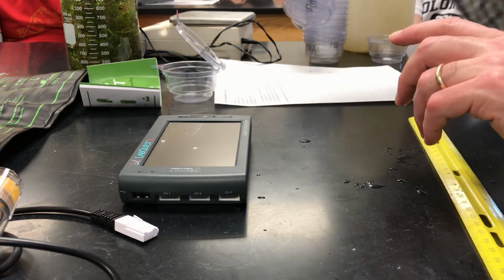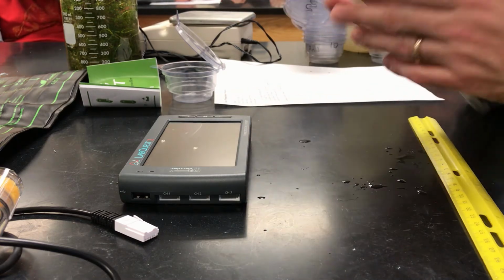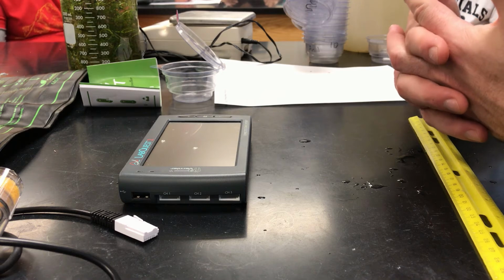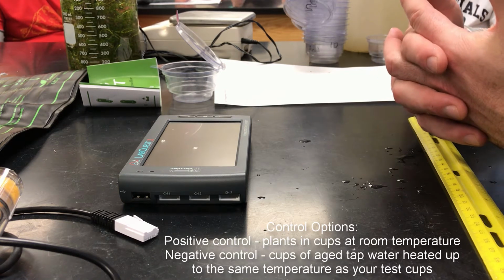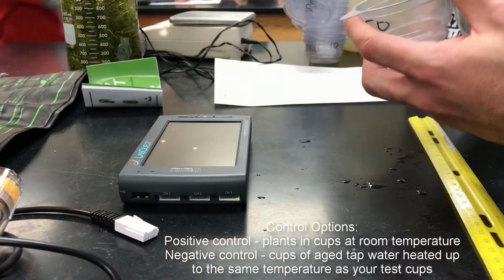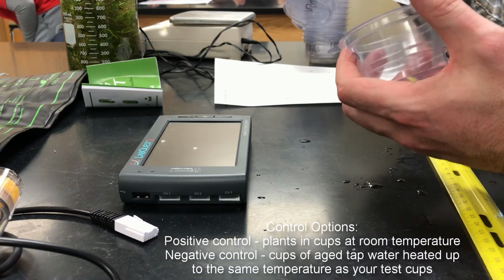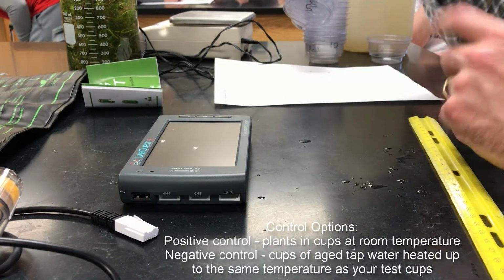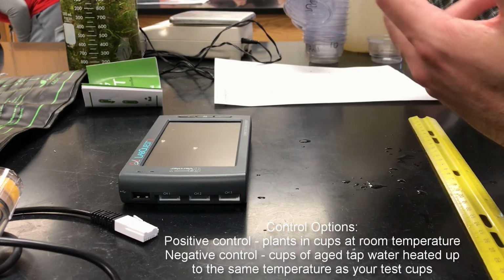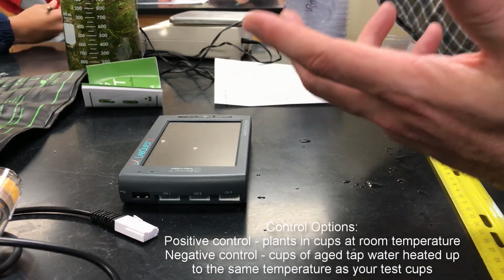So we're going to do 6 cups that are going to be tested on. The other 6 cups are going to be your control. Your control can be one of two types. You can either do a positive control, in which you take 6 plants and put them in there and do the same exact thing, but you're not going to apply the test condition to it. Or you could fill them up with the equivalent amount of water and then expose that to the same test conditions as the plant. Again, this is your choice.